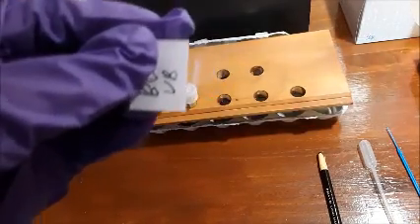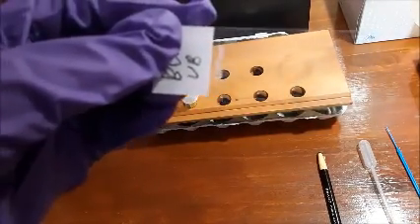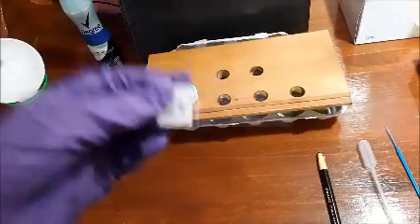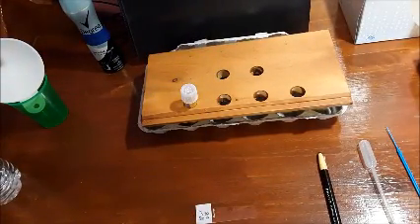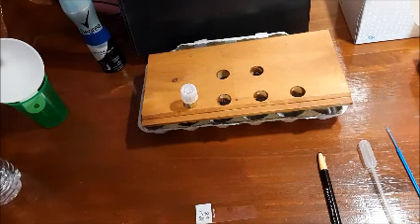I don't know if you can see that. Oh, there we go. But yeah, you're going to do that. I'm just going to put this back down. And once you've marked up your slide, you're now ready to actually begin the smearing procedure.